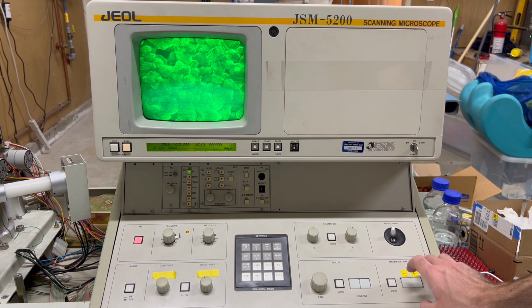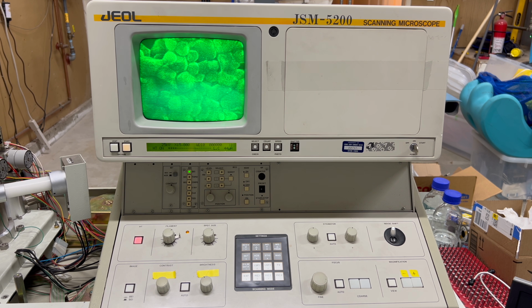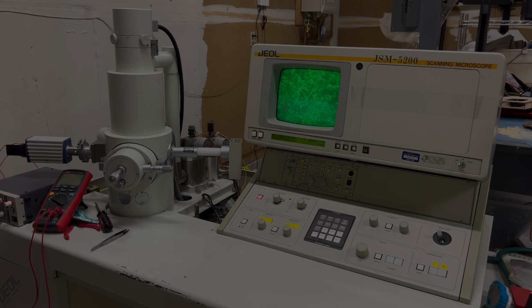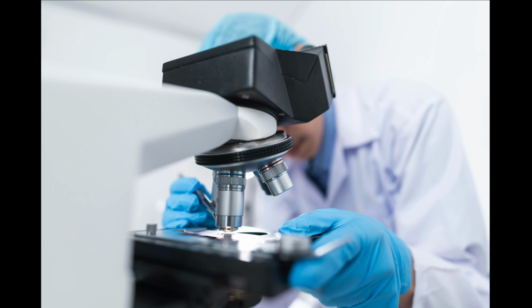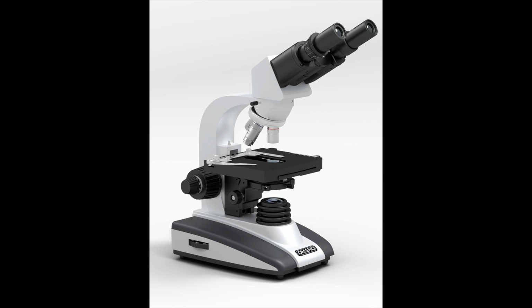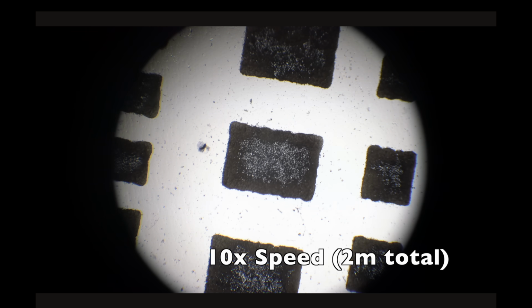After months of effort, I managed to get it working again. This video is the story of how that happened. Let me start from the beginning. Microscopy is one of my oldest hobbies. I got my first toy microscope in grade school, and in high school I saved up my money and bought a much nicer one. You might even recognize it, as it's been used multiple times on this channel.